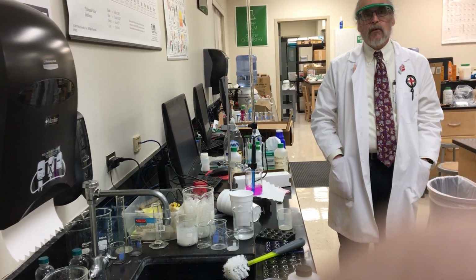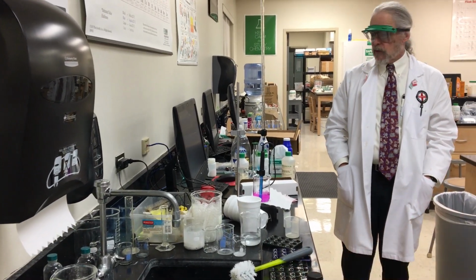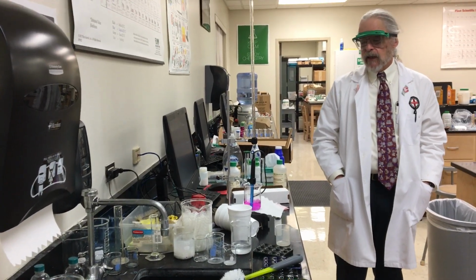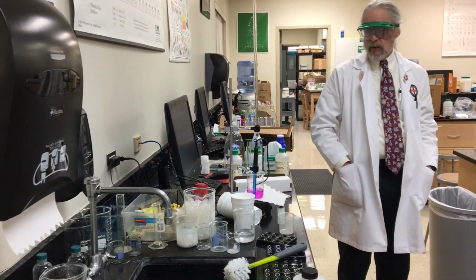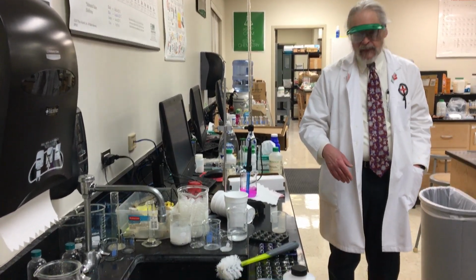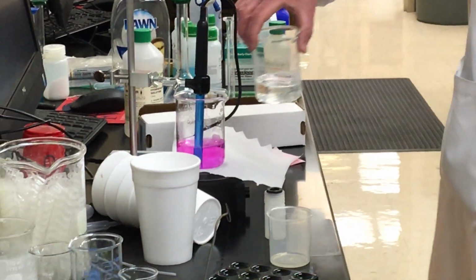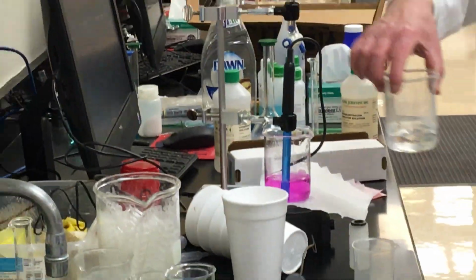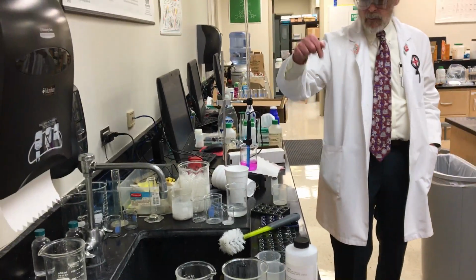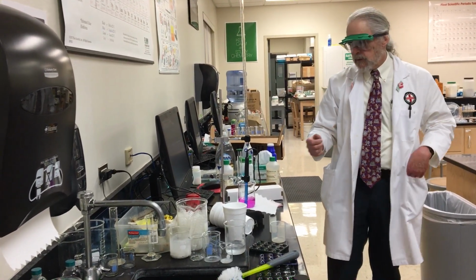Okay? Students normally get a little paranoid. They don't want to have to start over. I don't want you to have to start over, so people get kind of nuts. The biggest kind of nuts sometimes is I've had students standing there going, okay, that's it, we're done. And I'm looking at it going, it's as clear as that. No, you're not done. Not that, that's too far, but this isn't done at all. You're not there yet. You want that one drop where it turns light pink and then it stops.